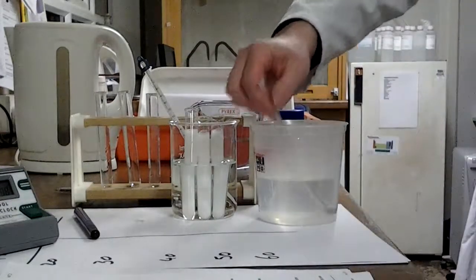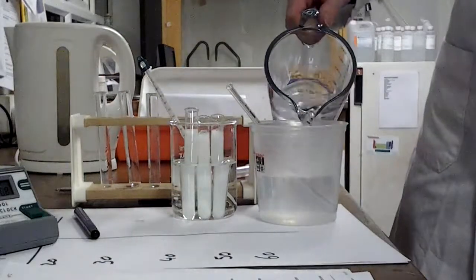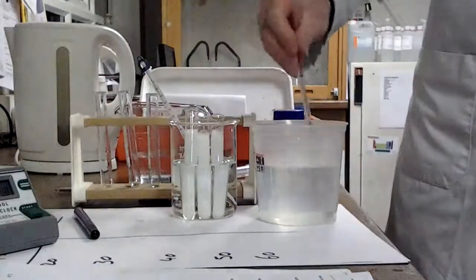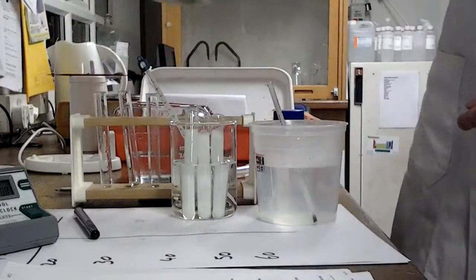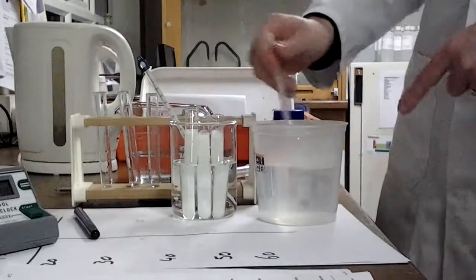Now this is currently sat at, it's a little bit too high actually, it's actually at about 45. So if I put a bit of cold in there, I can bring it back down to 30. But once that reaches 30 and I can start my next experiment off and get ready to equilibrate that, I'm going to have to keep topping it up with warm water, just a little at a time, making sure I can keep it at the right temperature level. You don't want it suddenly dropping down.